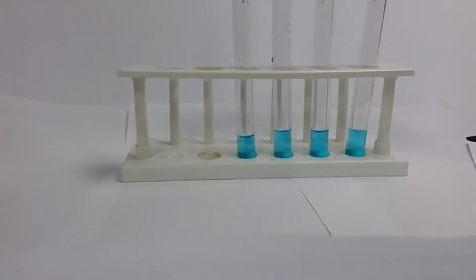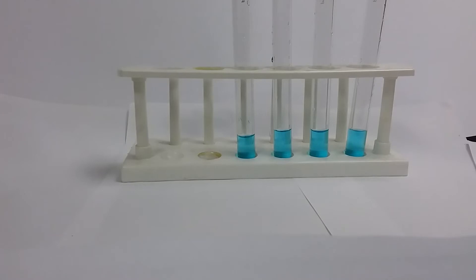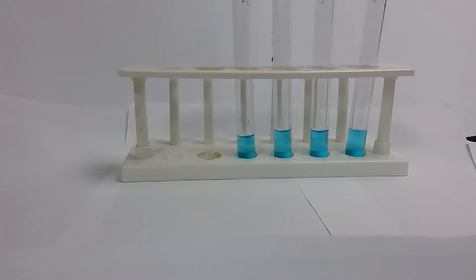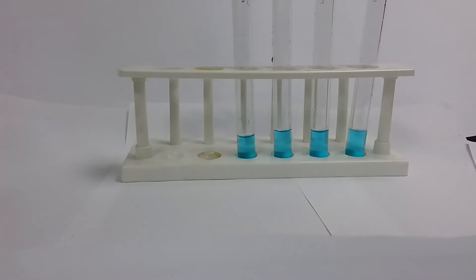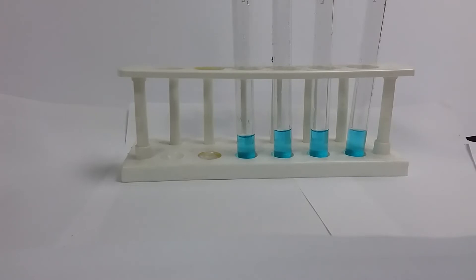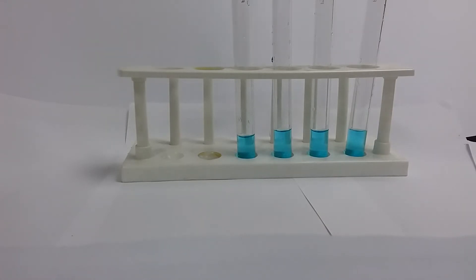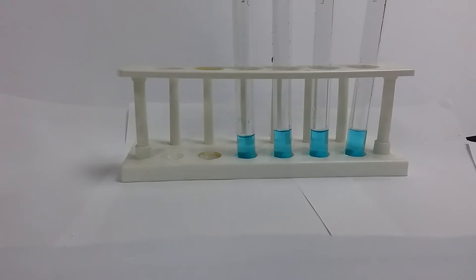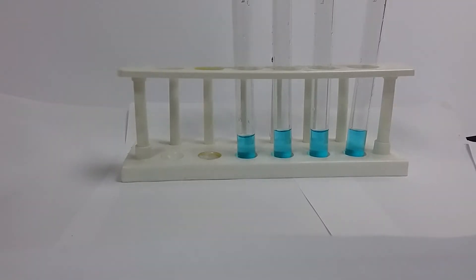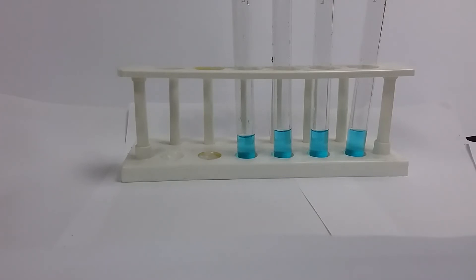Let's have a look at our next solution. First, we make some preliminary observations. Based on these preliminary observations, we can make some educated guesses. We're going to run through all of the same tests: sodium hydroxide, aqueous ammonia, silver nitrate, and barium nitrate followed by dilute nitric acid — the exact same tests, looking for the cation and the anion.